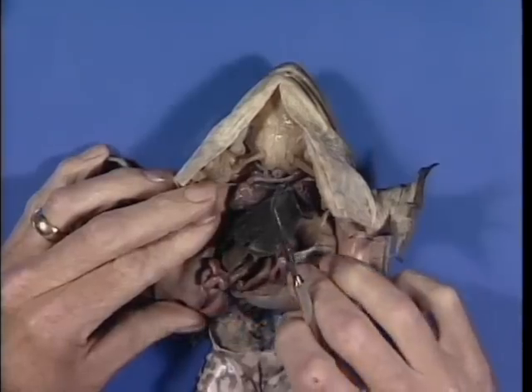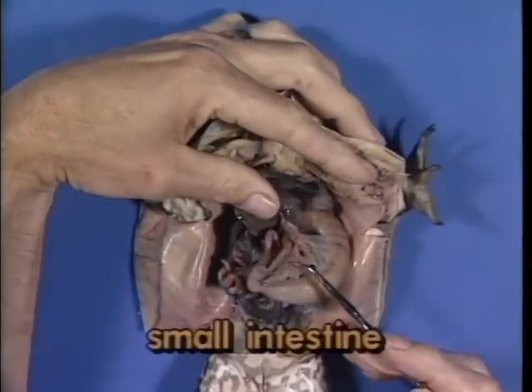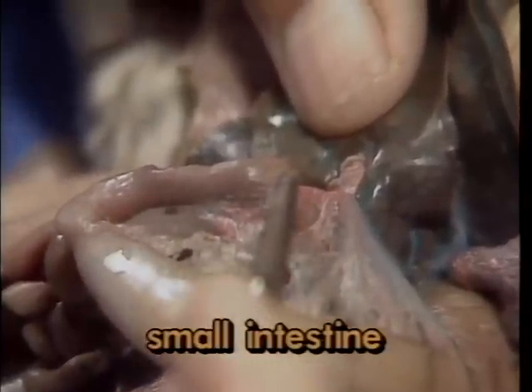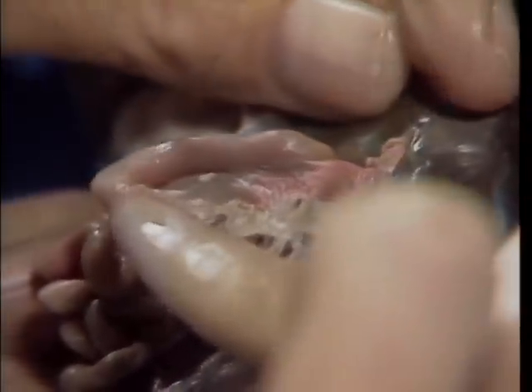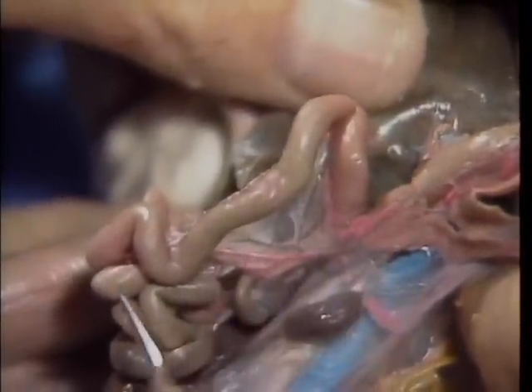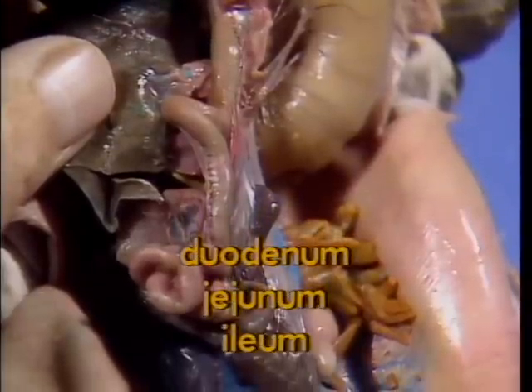The pyloric valve controls movement of food into the upper portion of the small intestine, where most digestive processes begin. In humans, the small intestine can be further regionalized from anterior to posterior as the duodenum, jejunum, and ileum.